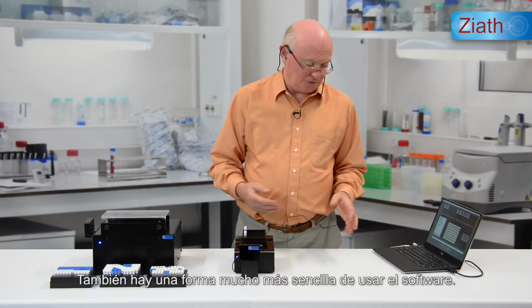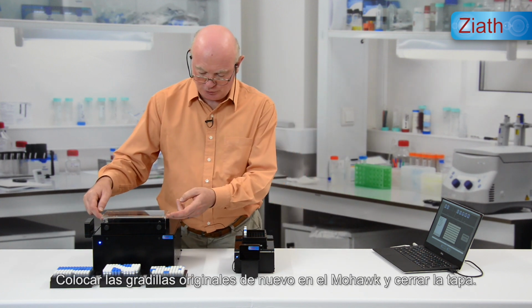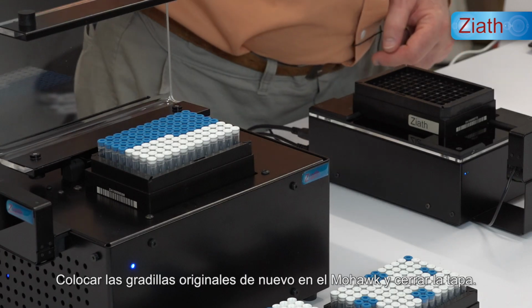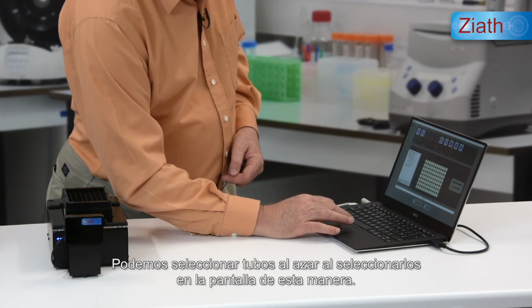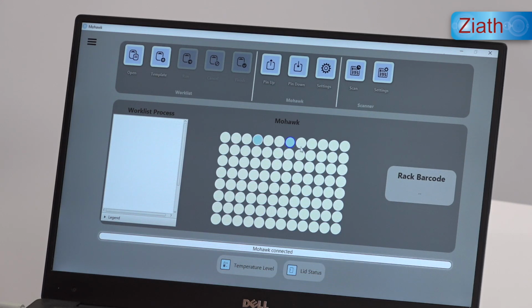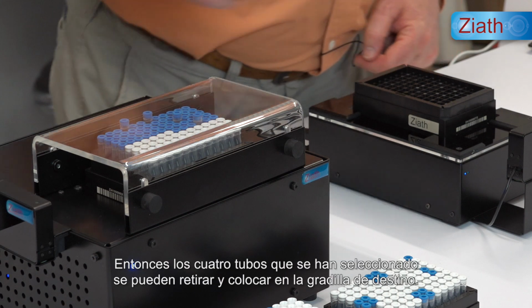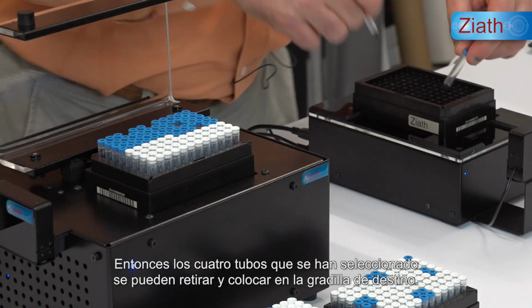There is also a much simpler way of using the software, and that's to manually pick tubes simply by entering them. So if we put one of the original racks back on, if we then close the lid, we're simply going to randomly select some tubes across the plate. They'll be selected by highlighting them on screen like this, and then pressing the pin up button will raise those tubes for picking, and the 4 tubes which have been selected can then be removed and placed in the destination rack.